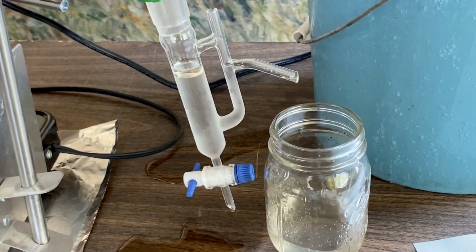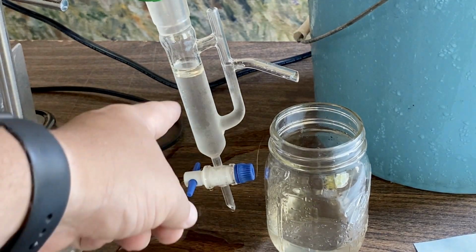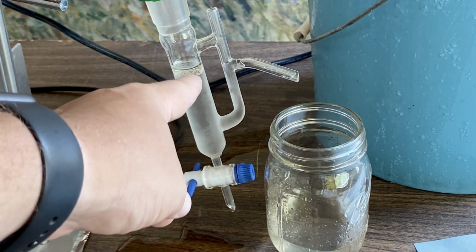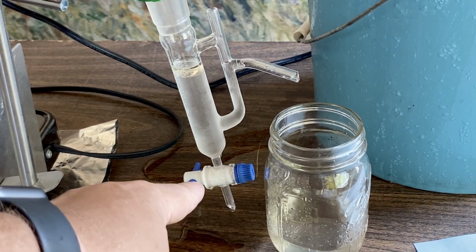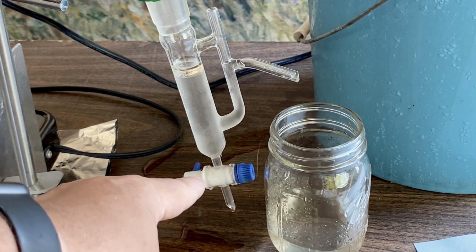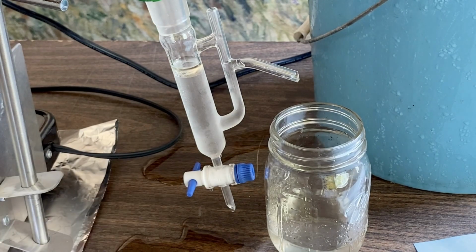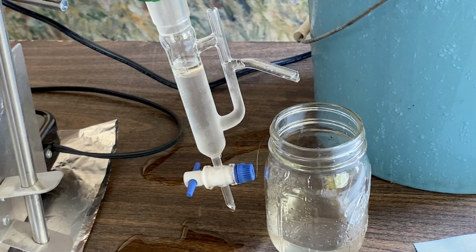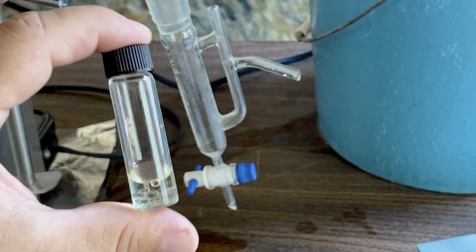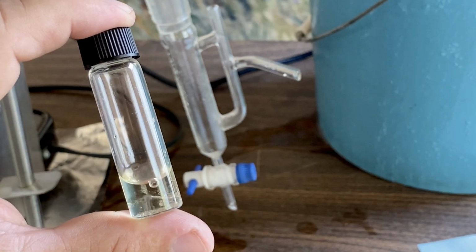A lot of people ask me, you know, once you shut it down, how do you get that amazing oil out? Well, what we're going to do is remove the water first and then position that oil right at the end of the valve tip. This is an easy valve. You unloosen it on the right side and turn it. Once I turn that, everything is going to drop out. So this takes a little bit of skill. You really want to do it slowly, otherwise everything drops out too quickly and you might lose that beautiful oil. Does not look like a lot, but these essential oils go a long way, just a few drops.